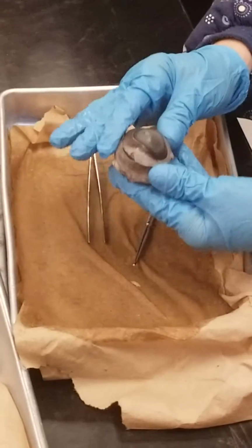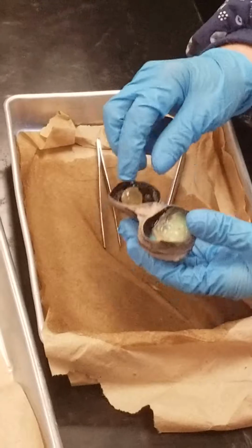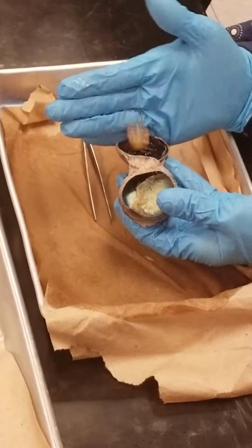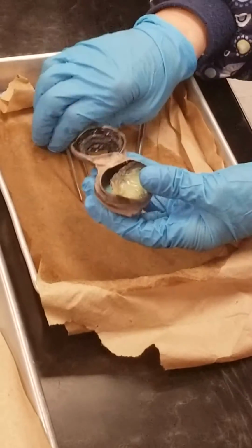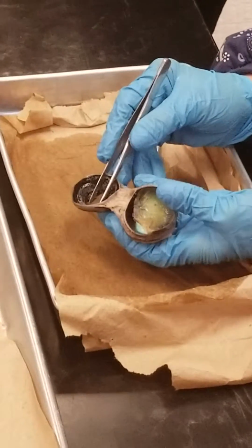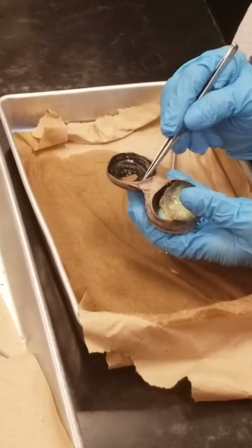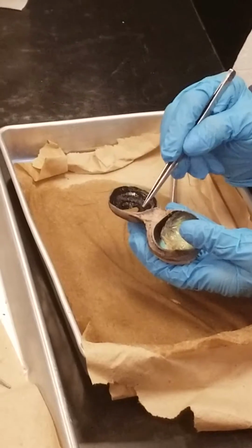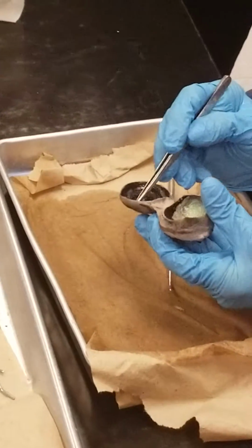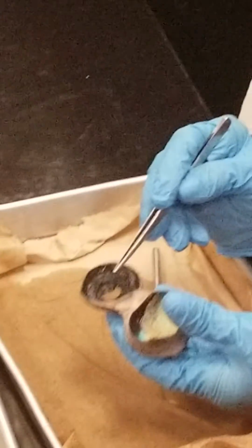Now I've already cut this one open, so I'm just going to flip it open. And the first structure we see is the lens. I'm going to pop that out. So there's the lens. That lens covers the hole there, and the hole is the pupil. So that's the pupil, and surrounding the pupil is this black stripe structure. That's the iris, and cows all have a black iris. We have different colored eyes, so our iris will be blue or green or brown.